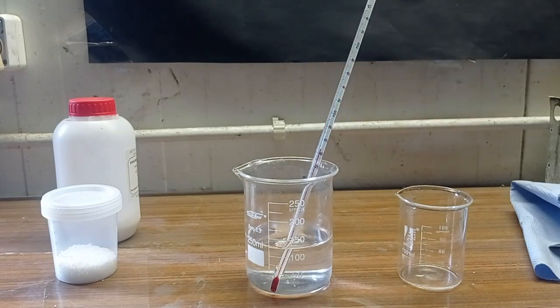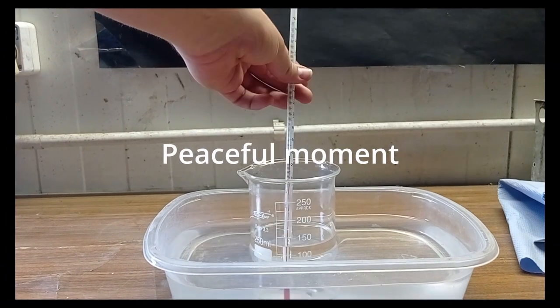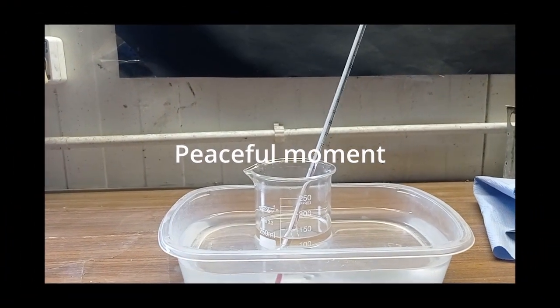Yeah, I have to take a water bath. Unfortunately, I don't have a smaller thermometer, but I don't care. I just have to be careful not to break it, or whatever else I can do with it. Okay, I think I can.